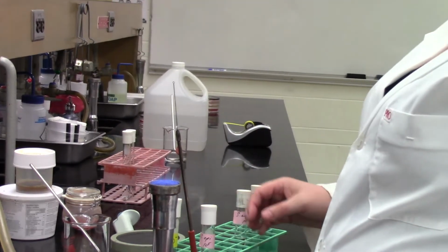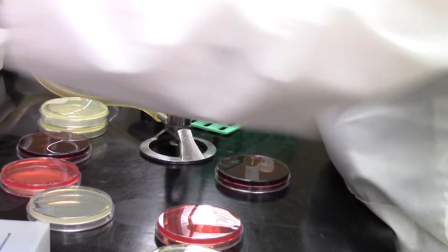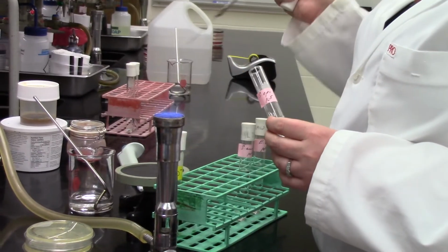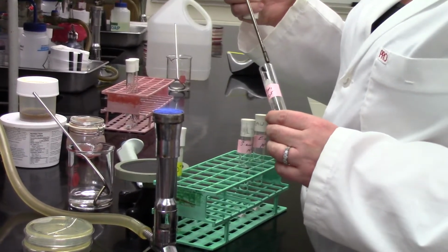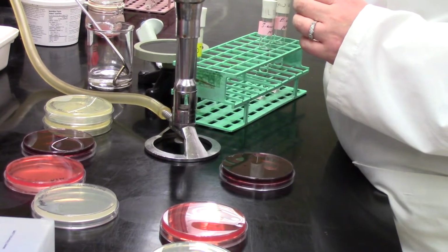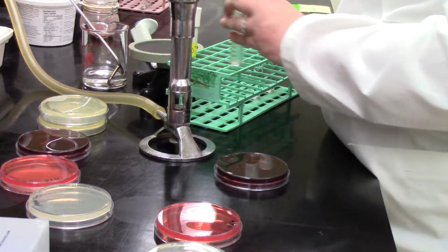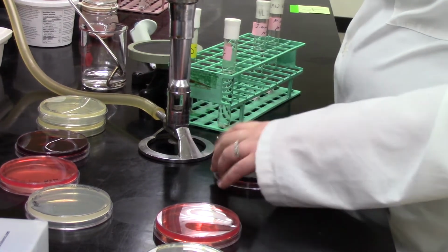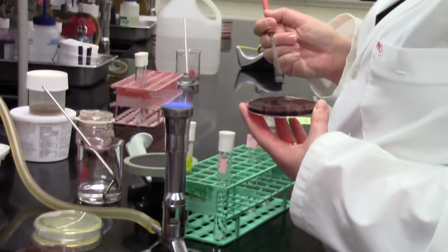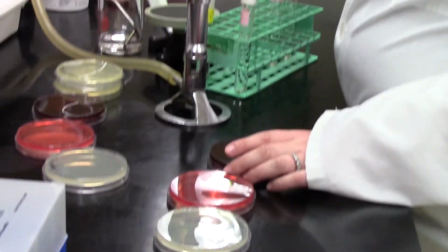She's now going to grab another plate. This is a deep purple color, and this is the eosin methylene blue, or EMB agar. And she's doing the same type of bacteria. So she's going to work through all of the different media types we're working with today. And she's going to inoculate the same bacteria onto each of them. Then she's going to go back and start over and work through those plates again, doing that same squiggle kind of inoculation of 1/3 of the plate. So there, she's doing her third for the EMB plate.